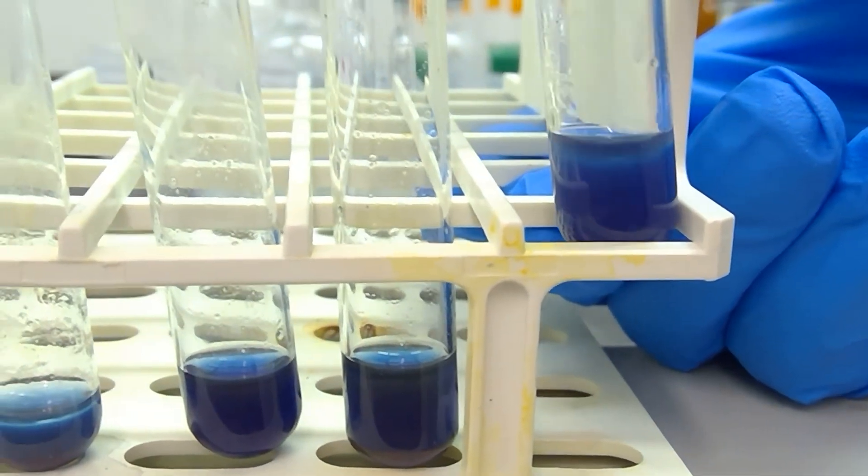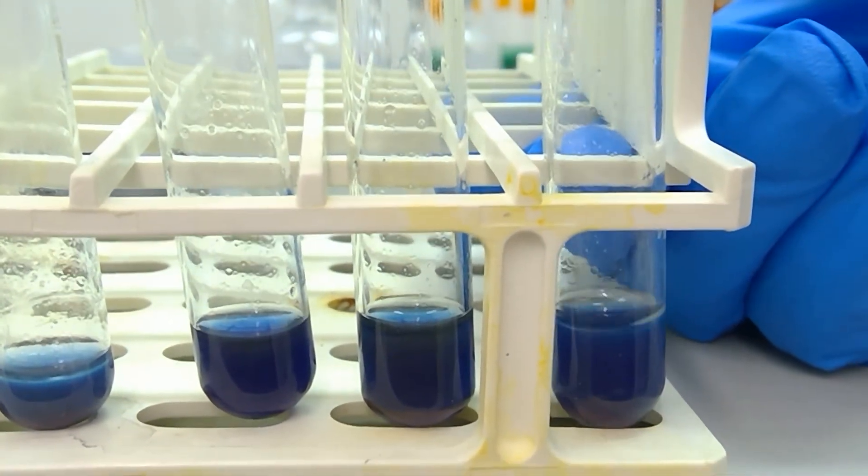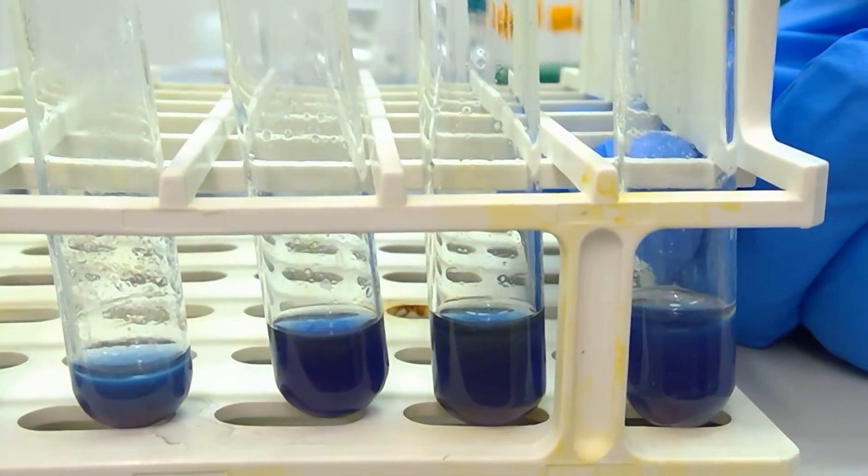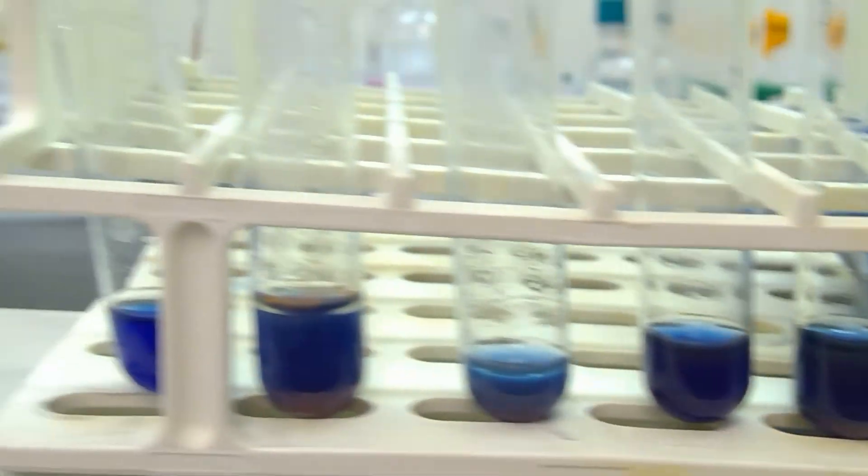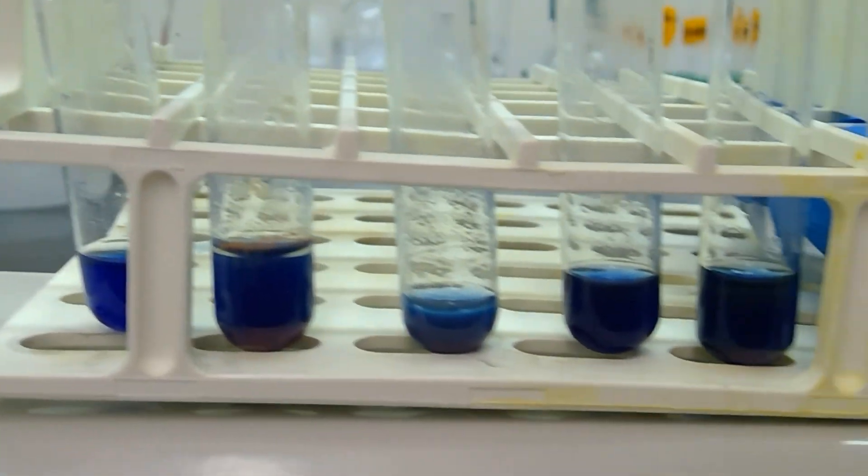Last but not least we have acetophenone, which is a ketone, which looks like it's developing a two-layer system but no red precipitate. This has been the Fehling test, and it looks like our only positive sample is our aliphatic aldehyde, heptanal.